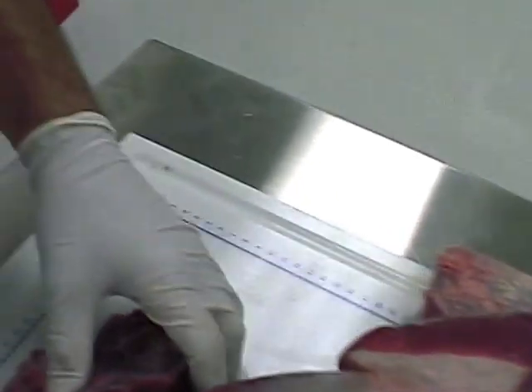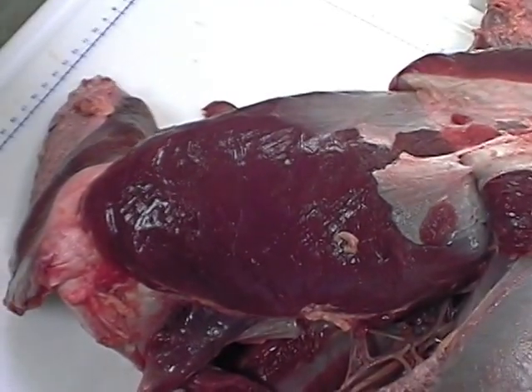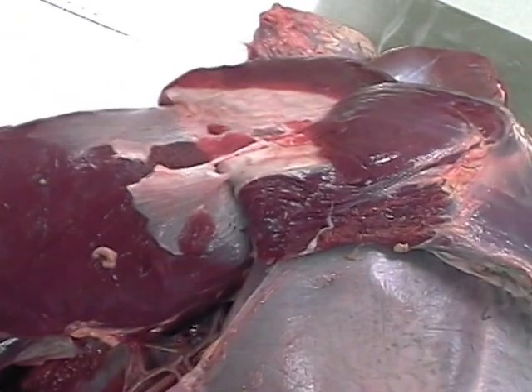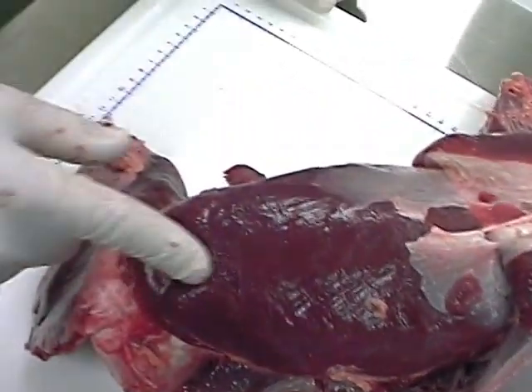And now on the surface of the thigh, this is femorotibialis lateralis, and I think we've covered pretty much everything.